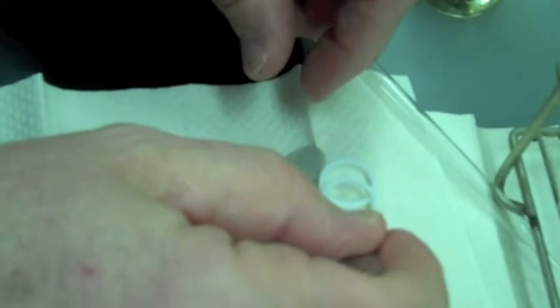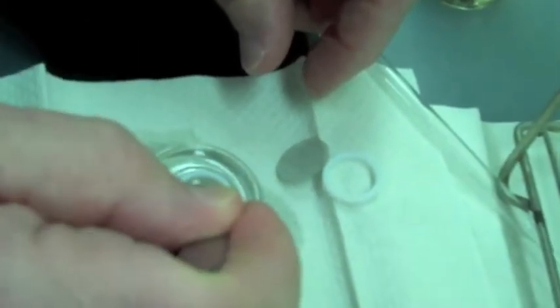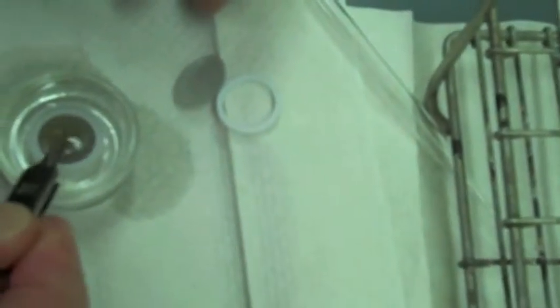And then a screen, another spacer, another sample, quickly so it doesn't dry out, another screen.